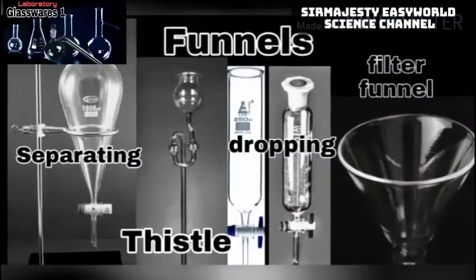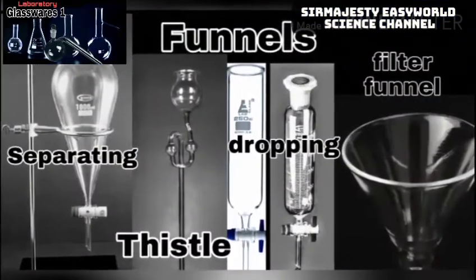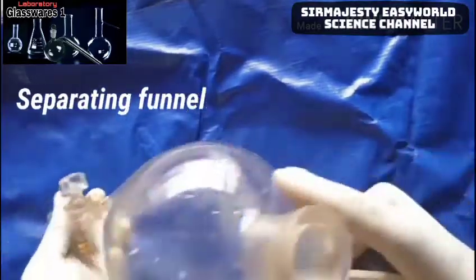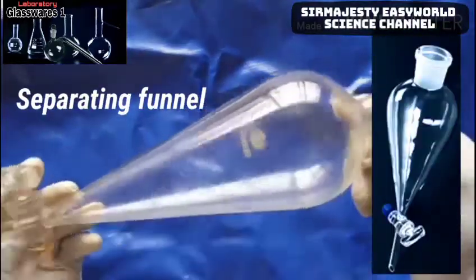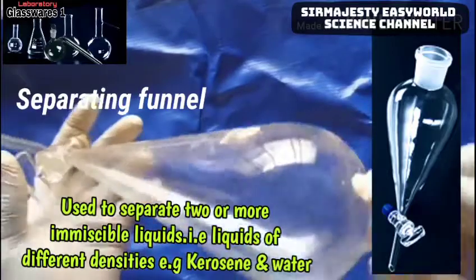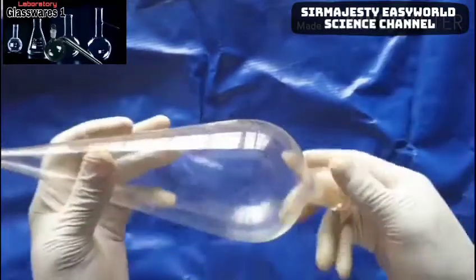Today we'll take a look at glassware. First, we start with some common funnels. Here is the separating funnel, or separatory funnel, used to separate two immiscible liquids. Watch my video here where I used it to separate kerosene and water.